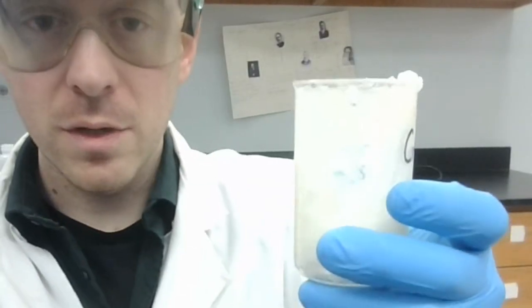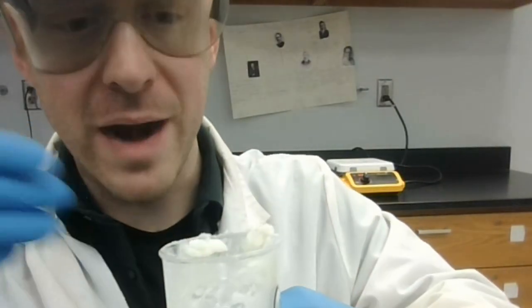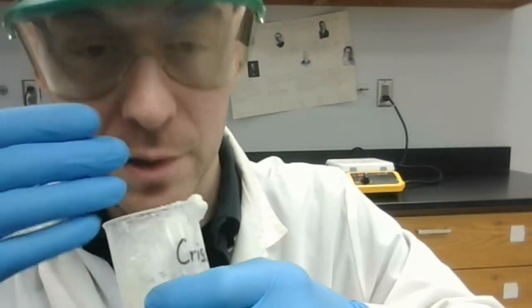The Crisco coming up second. Crisco has a much more pronounced scent, even though it's not incredibly strong by any means. There is a scent with Crisco. It reminds me of baking because I bake with Crisco sometimes. So Crisco definitely has a scent, sort of like a cooking oil.